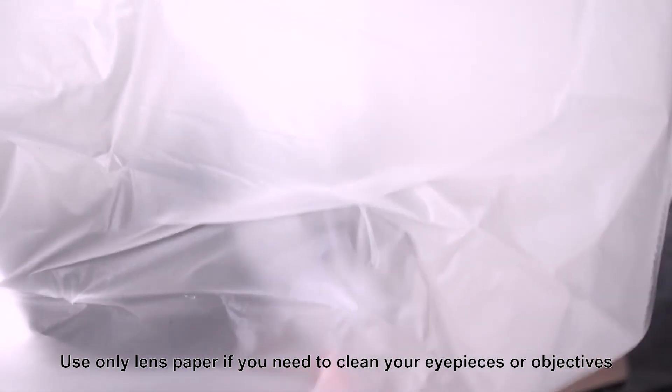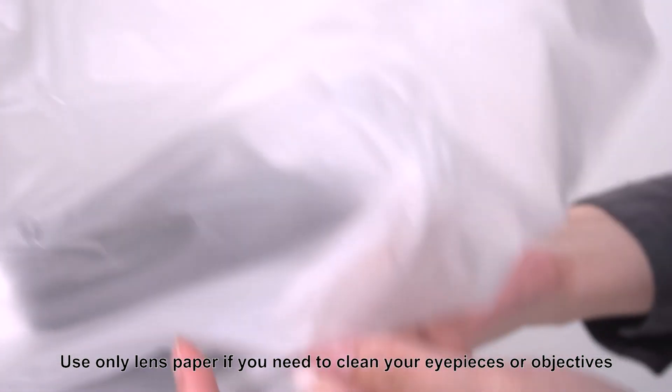Use only lens paper if you need to clean your eyepieces or objectives. We hope you enjoy using your SWIFT microscope to discover more about the world around you.